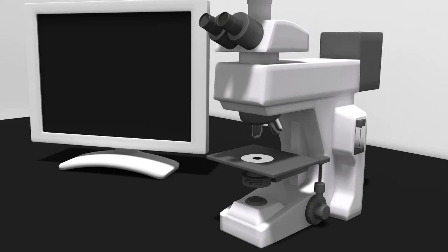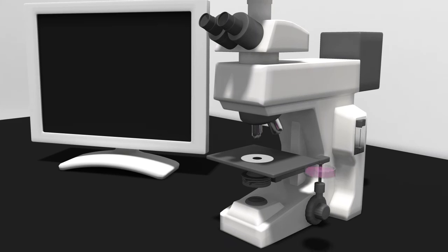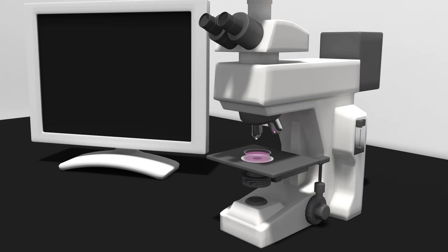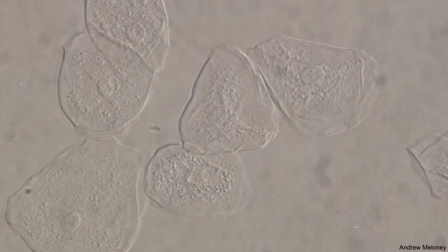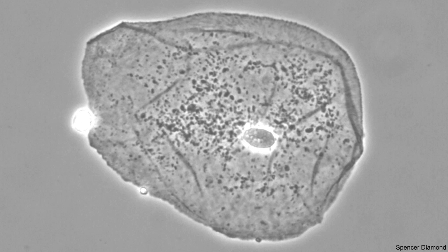A microscope is used to view many different types of samples, including cells growing in tissue culture, tissue samples, or whole organisms. While cells growing in tissue culture can often be simply placed upon the microscope, other samples need to be prepared and processed prior to viewing. Many samples are transparent and lack sufficient contrast, so phase contrast microscopy can be used to view such transparent samples — such as unstained cells growing in tissue culture — as it increases the contrast. However, phase contrast microscopy cannot be used to view specific proteins or some cellular structures.